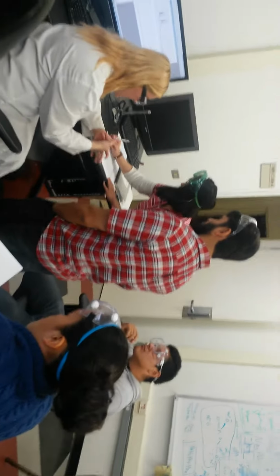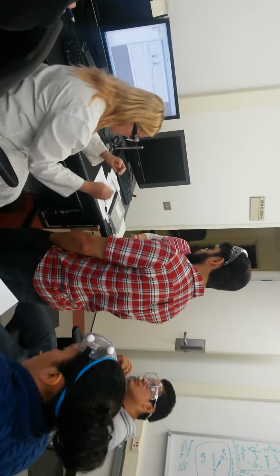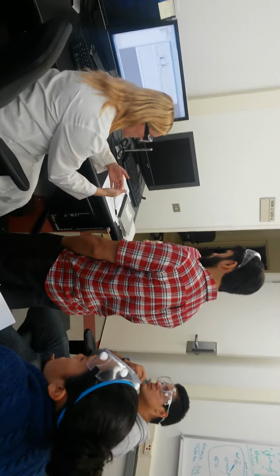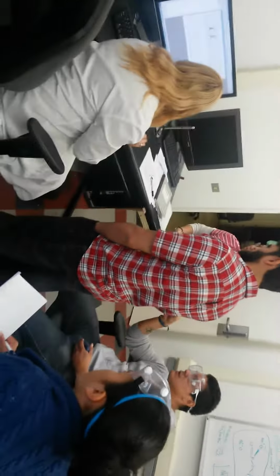Then it sends that sample to the MS. It has to go through a whole bunch of coils, a whole bunch of tiny little capillary tubes, be evaporated before it can finally hit the detection. So you're saying the time that it takes to go through all that, you add to the MS time.